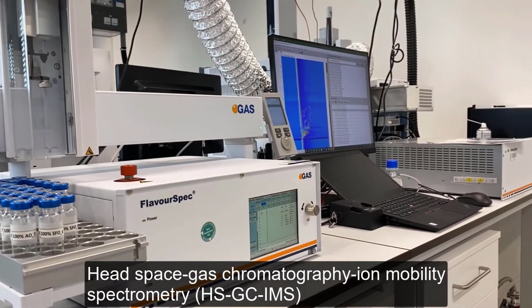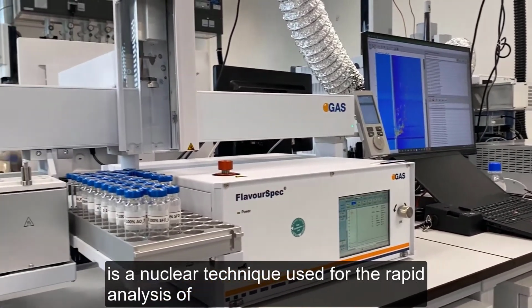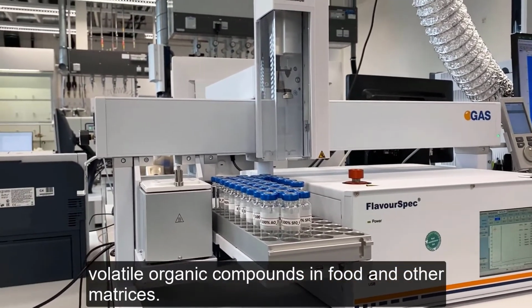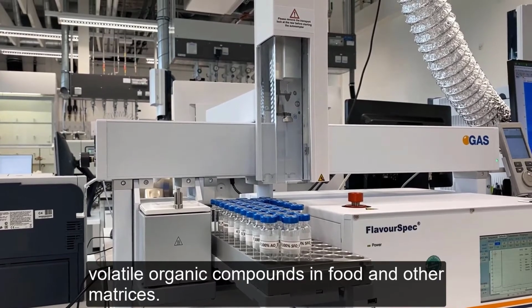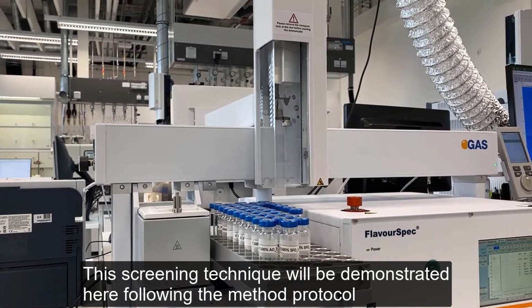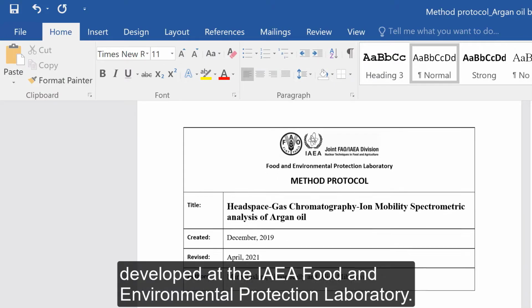Headspace gas chromatography ion mobility spectrometry is a nuclear technique used for the rapid analysis of volatile organic compounds in food and other matrices. The screening technique will be demonstrated here following the method protocol developed at the IAEA Food and Environmental Protection Laboratory.